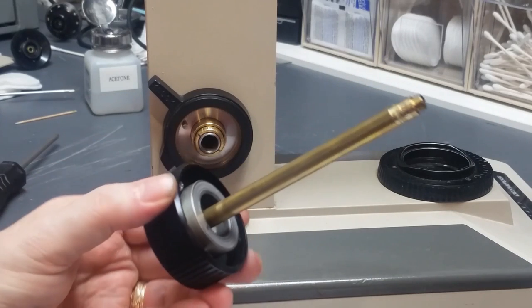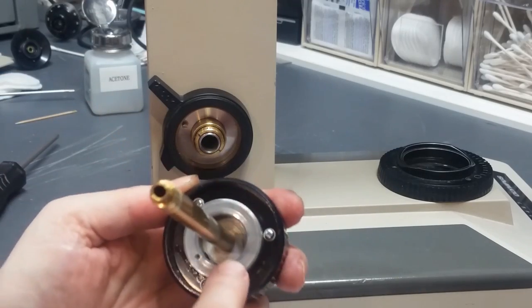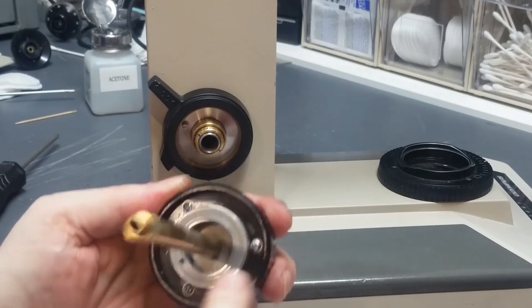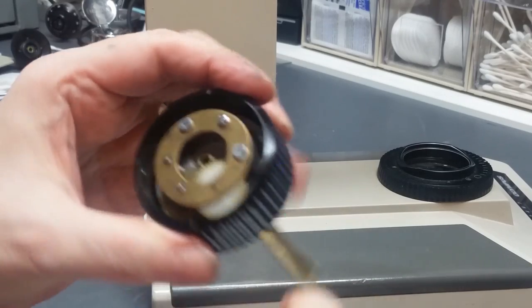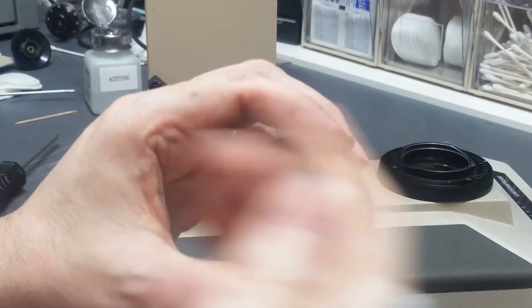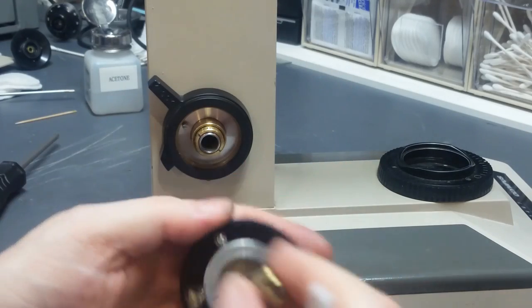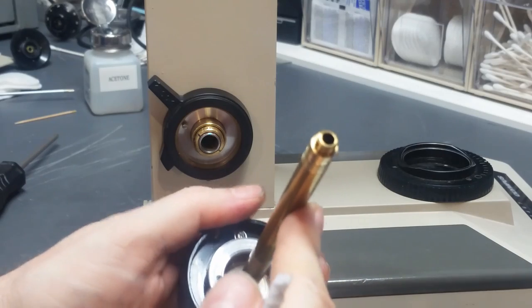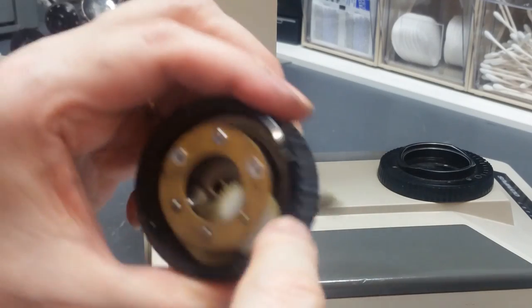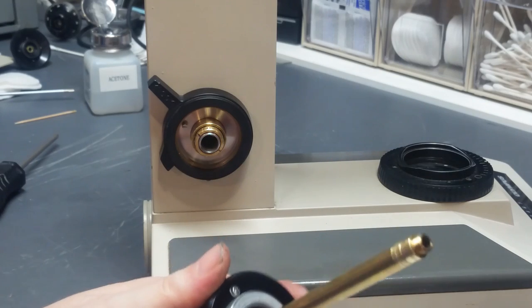Okay, next is going to be the installation of this assembly here. At this point, I've cleaned all the grease off of this bearing surface. There was a lot of grease on there. I've cleaned that all off. There's grease in here. I have not disassembled or cleaned any of this. I won't do that until this is back in the stand. I also want to run a pipe cleaner saturated with solvent through this inner tube here just to make sure that there's not grease buildup in there. So let's do that now.